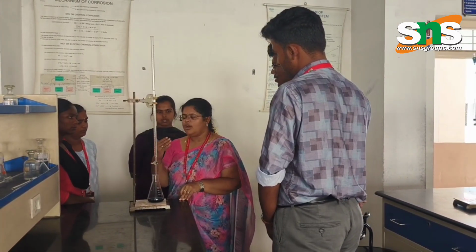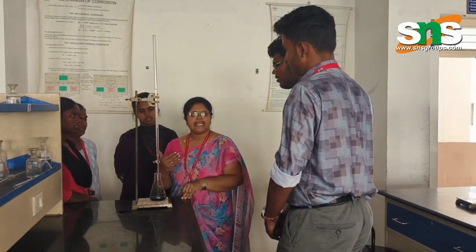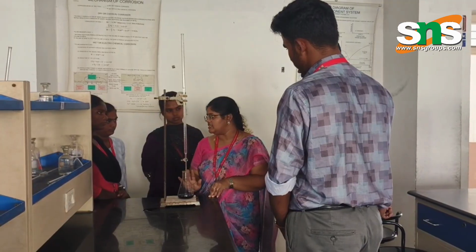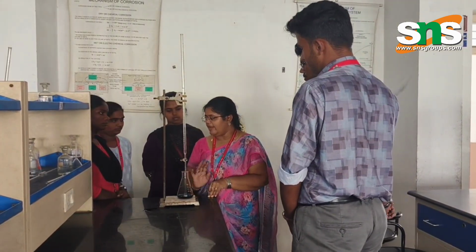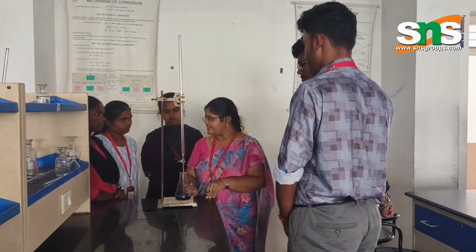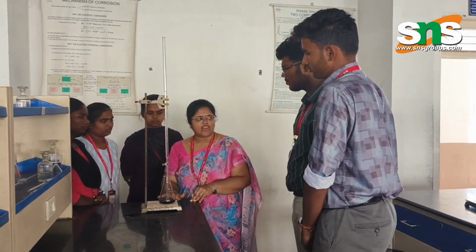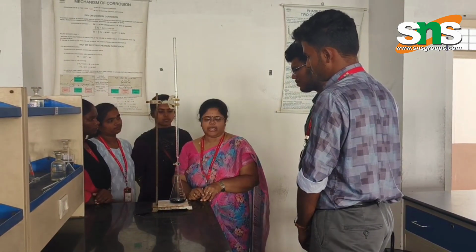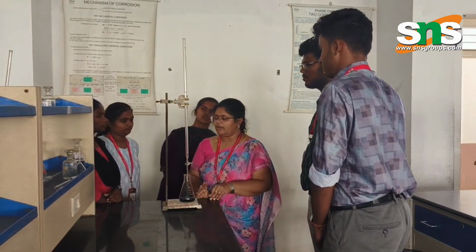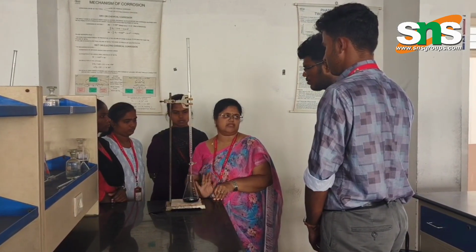It is going to form a complex. The calcium and magnesium form a complex with the EDTA. The EDTA complex is colorless, it does not have color, but you are seeing blue color. This is the color of the EBT indicator, which is blue in color. So this is the color of the free indicator. Now I have got the burette reading as 16, right? Now I am going to find the strength of the EDTA by using this value.